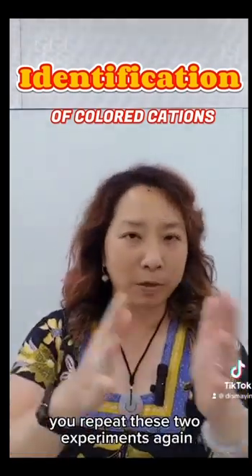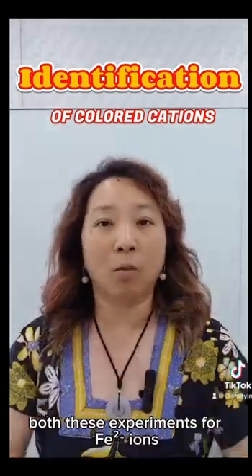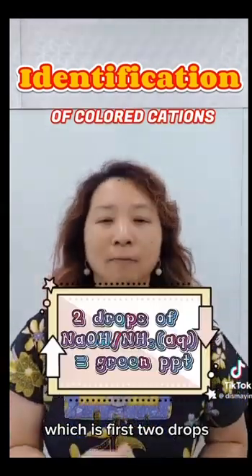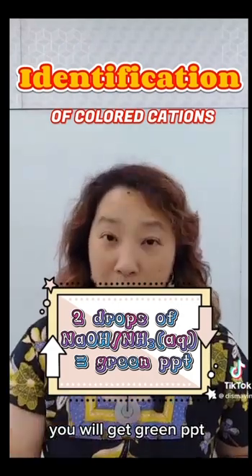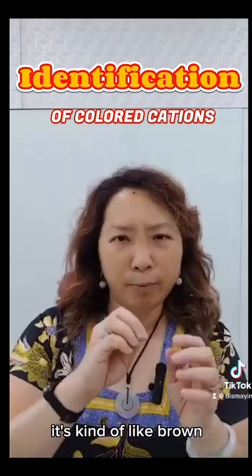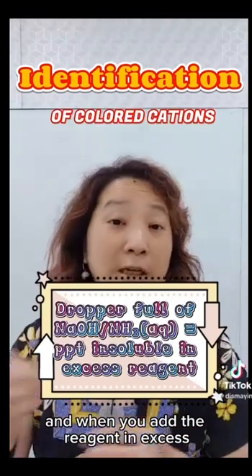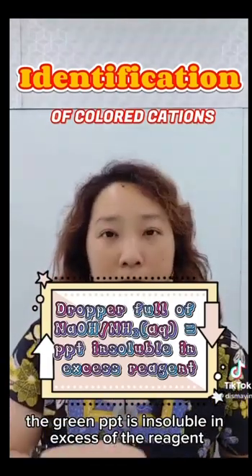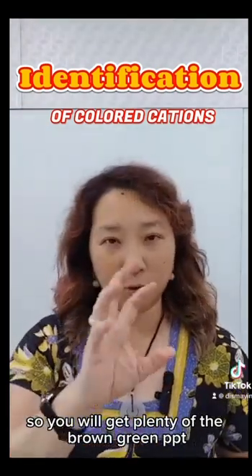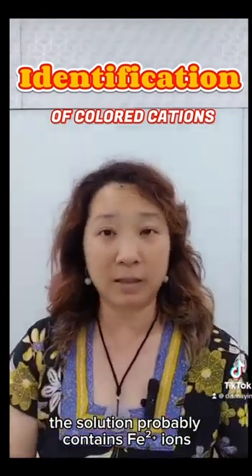Then what do you do? You repeat these 2 experiments again, first with sodium hydroxide and next with aqueous ammonia. Both these experiments for iron 2 would give you exactly the same outcome, which is first 2 drops, you will get green PPT. Now, this green PPT is not a very nice green. It's kind of like a brown-green color. When you add the reagent in excess, the green PPT is insoluble in excess of the reagent. So you will get plenty of the brown-green PPT. If that's the case, you can conclude that the solution probably contains iron 2 ions.